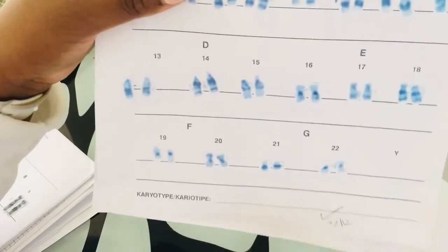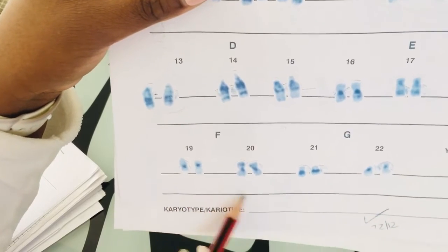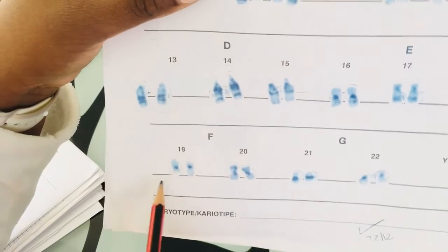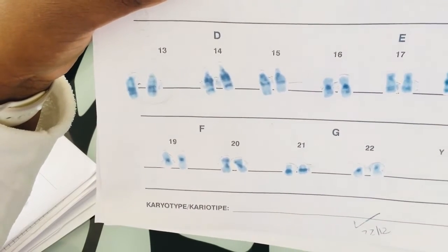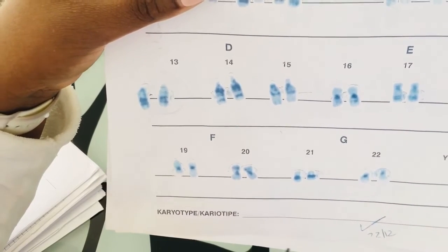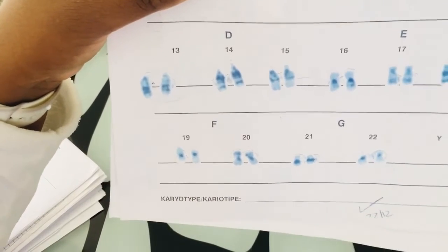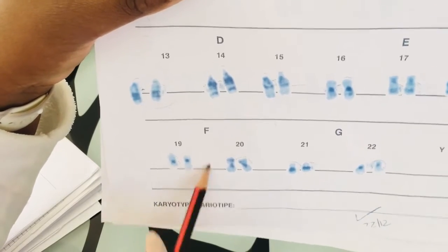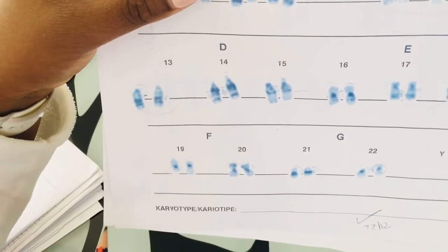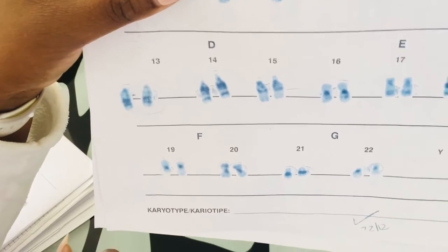So moving to my other favorite, chromosome 19, flower. Remember what I was saying? The shape looks like a flower. It's like a small version of chromosome 16. 19 is a small version. But then you're going to remember one thing. The centromere in the middle, it's dark and it pops. It just makes it obvious. Like, hi, I'm chromosome 19. Period. So it makes it obvious that it really is chromosome 19 because it has this dark dot or centromere right in the middle of the chromosome.